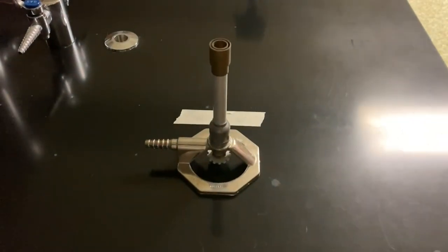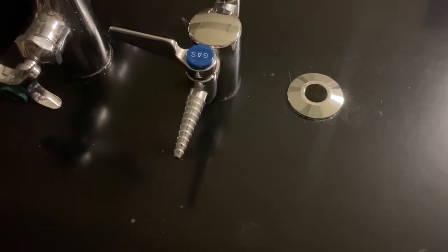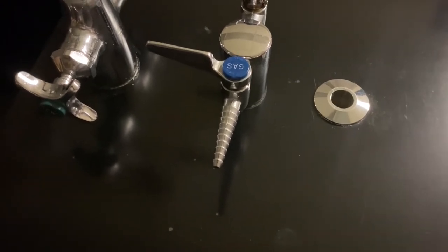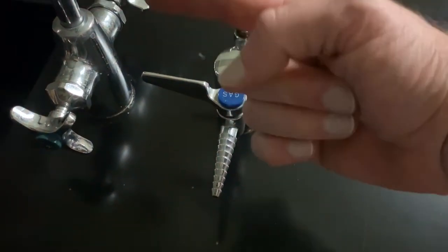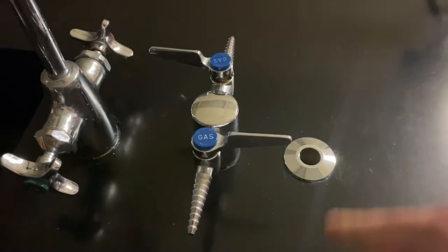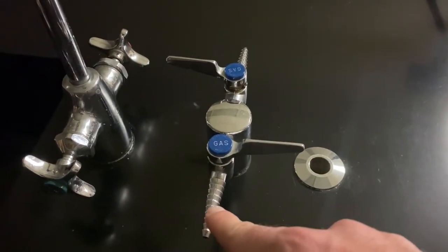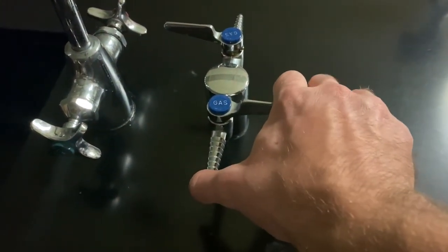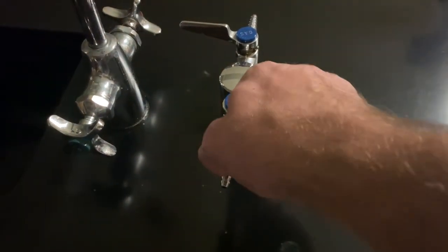The burner needs to be hooked up to a gas jet — a gas source that's usually hooked up to a laboratory table. There is a valve on the gas jet. When the handle is perpendicular, the gas is off. To open it, you turn the handle parallel to the jet, which opens the valve.